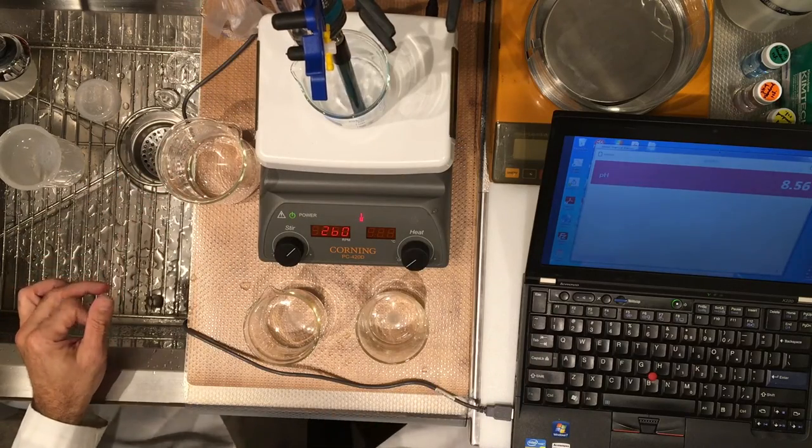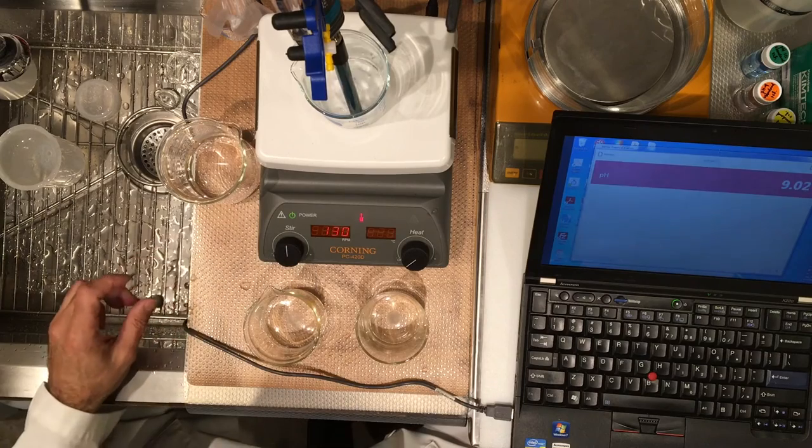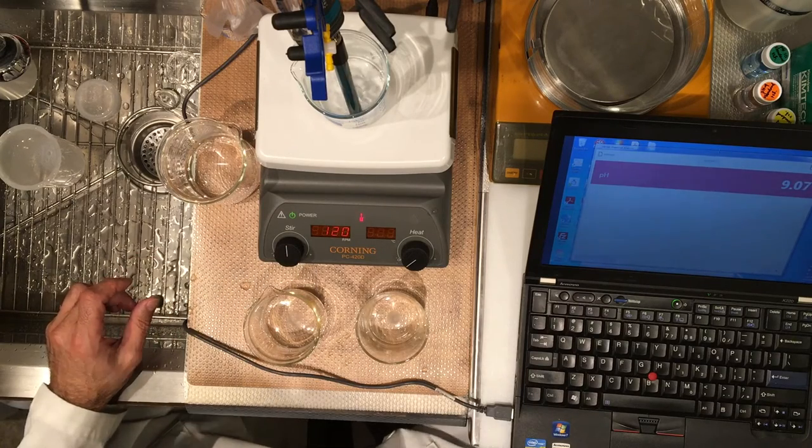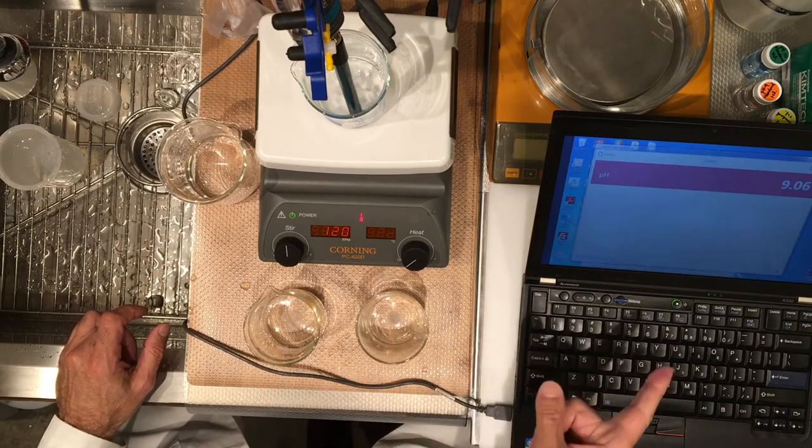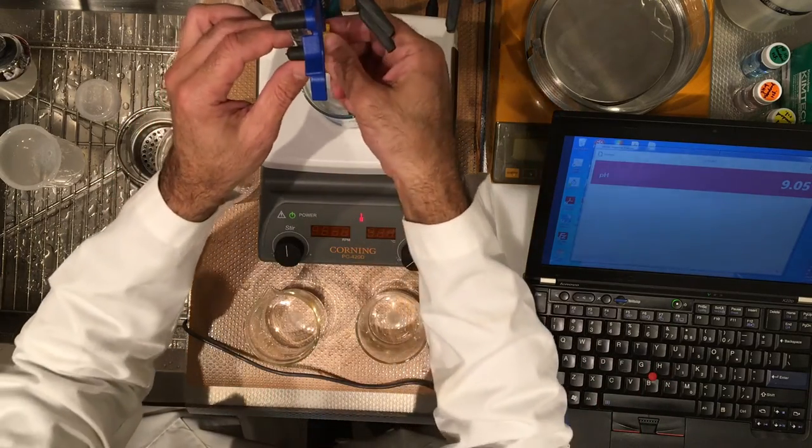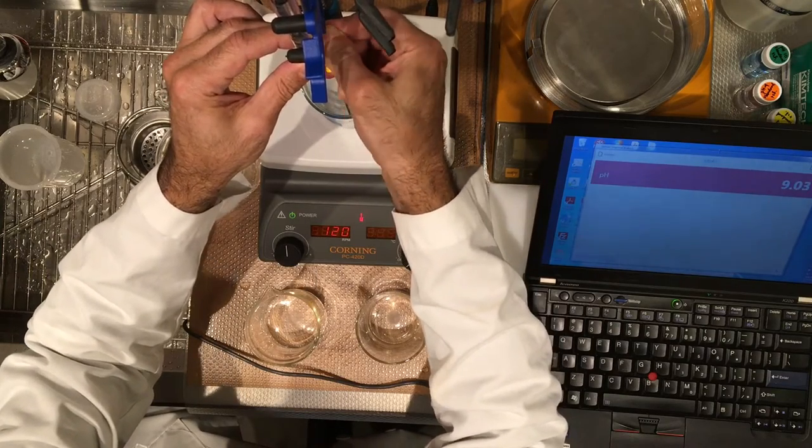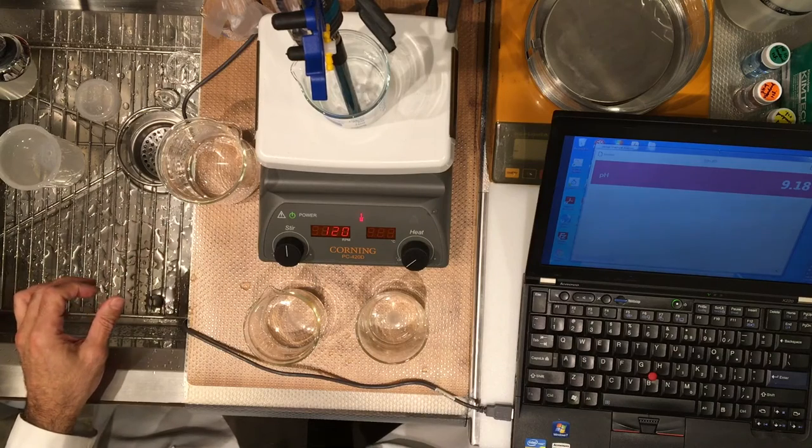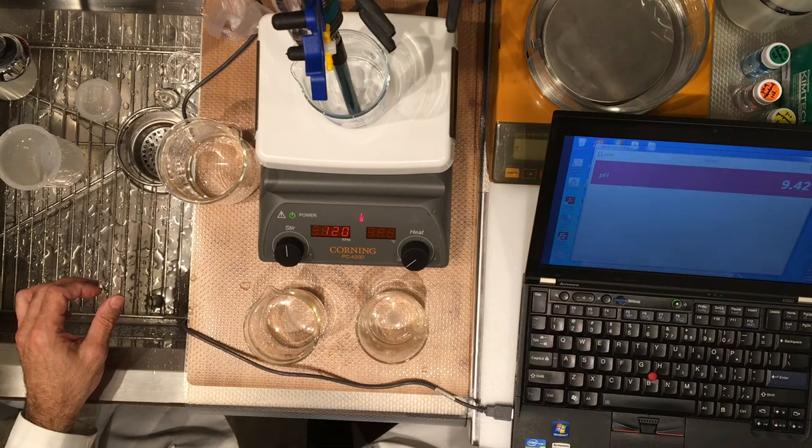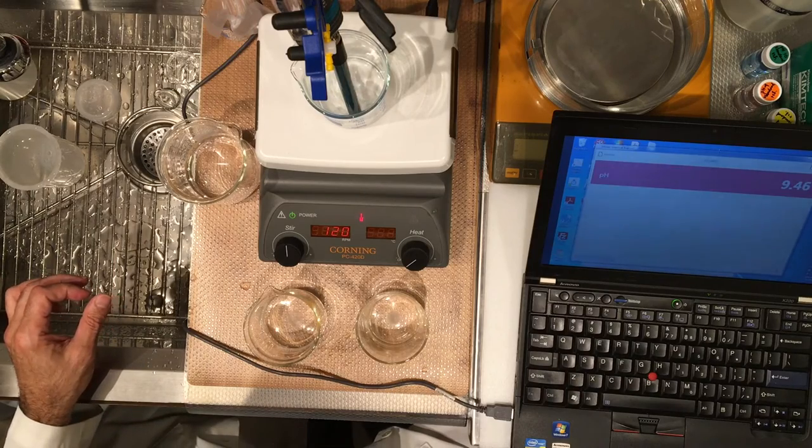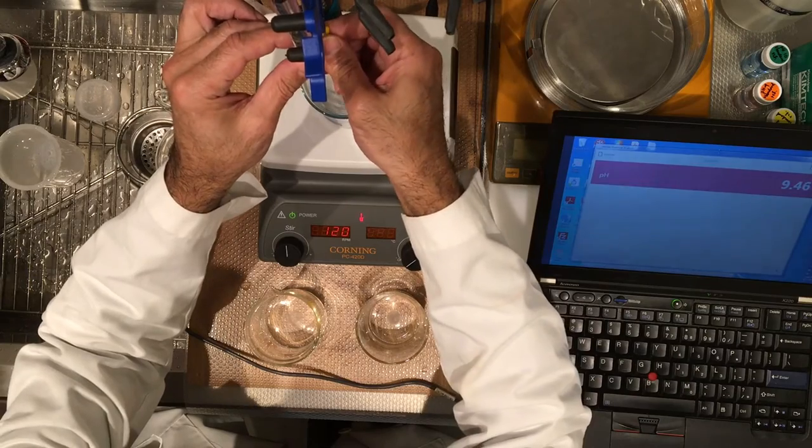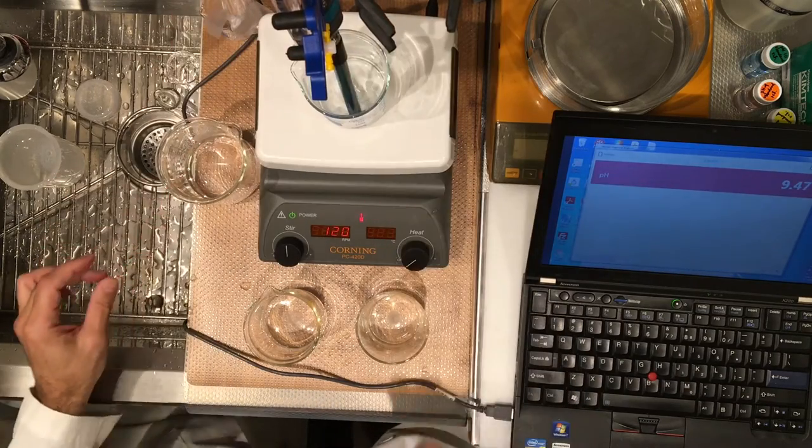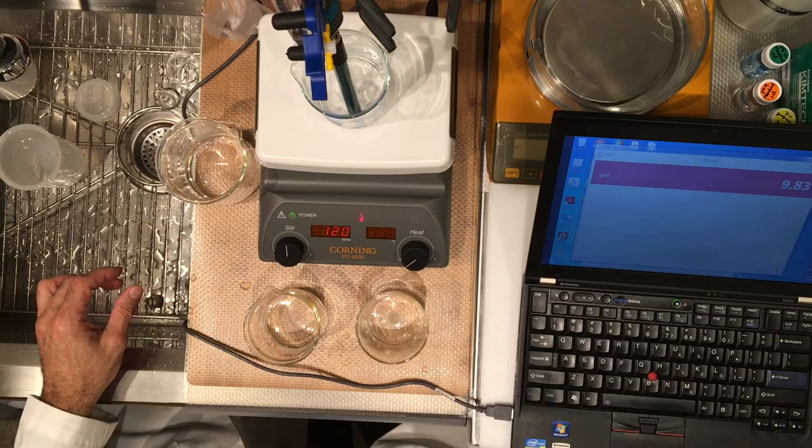11.15. This is 11.15 so I went a little over so record at 11.15 this is the value. 11.20. pH is changing more rapidly. 11.20 that's the value. 11.30. It's a big change there.